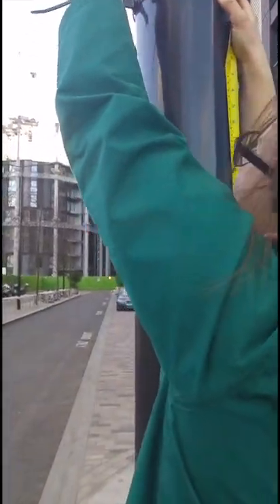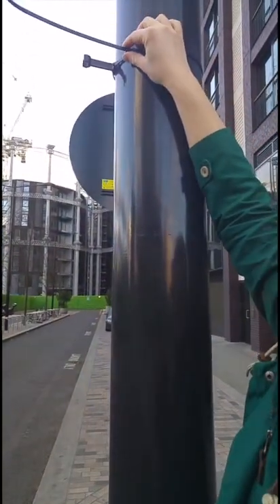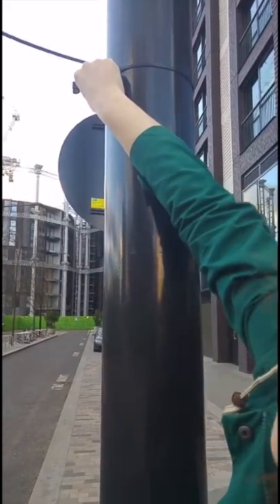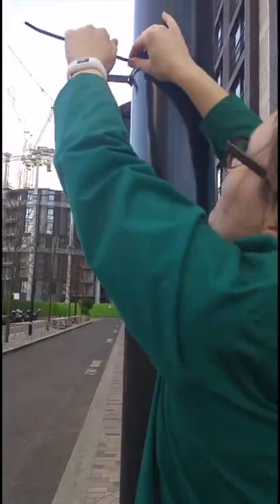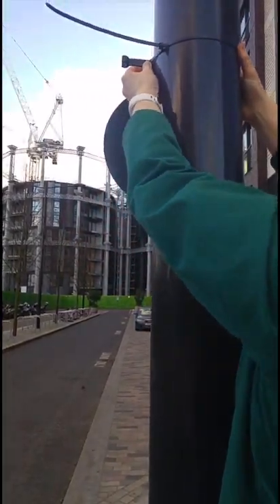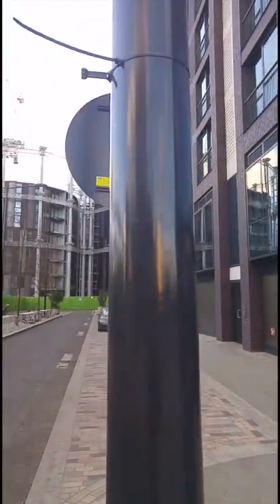You can see that I'm positioning it so that the tube faces the road side. That's nice and tight. Now I'm going to trim the excess.